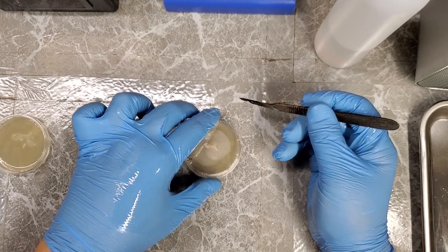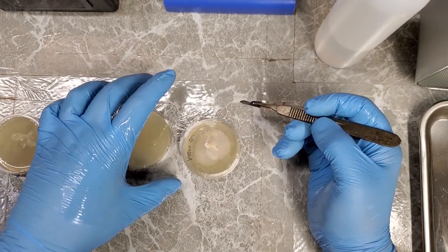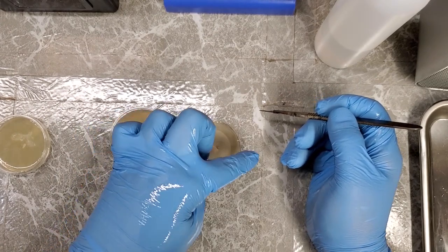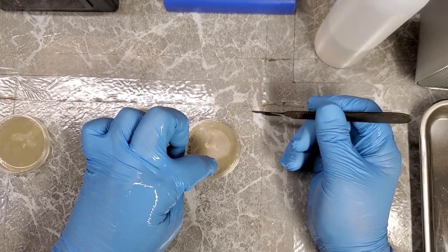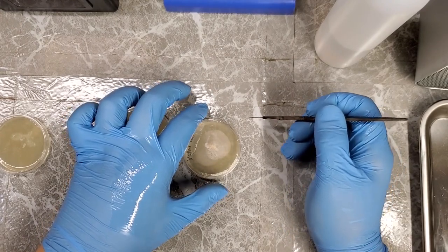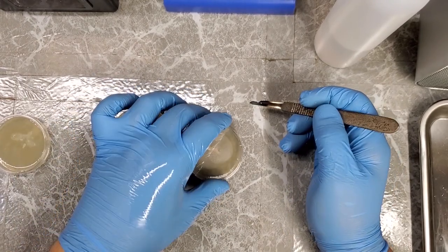If you're not sure whether or not your scalpel is cool enough, see how there's nothing over here on this part of the agar, how it's completely devoid of any colonies of bacteria or anything? You can just plunge your knife blade into that to make sure it's cool enough, and then you can take your sample. Next sample now.